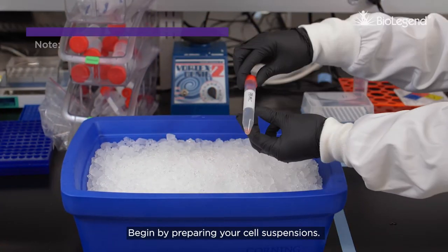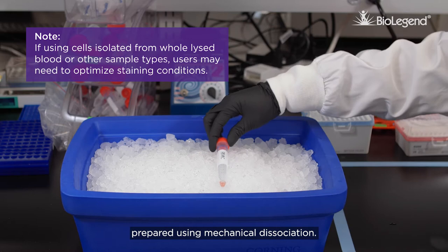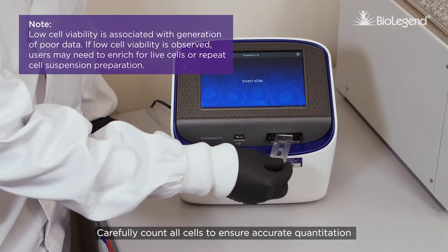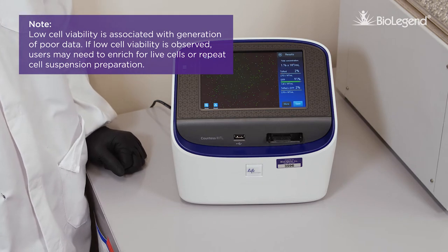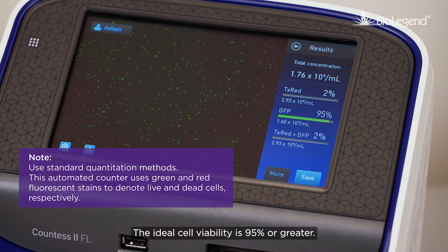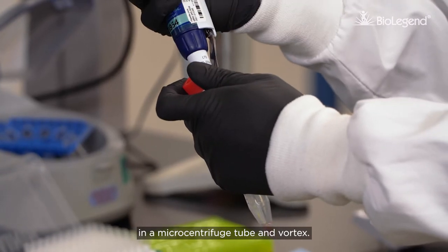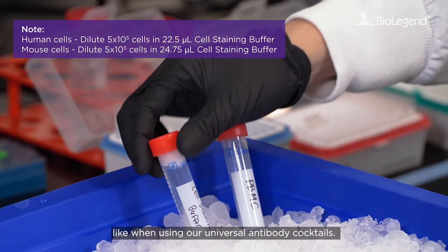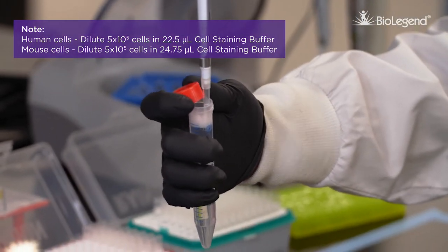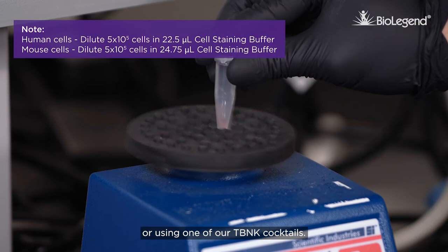Begin by preparing your cell suspensions. This protocol has been optimized using fresh human PBMCs isolated using Ficoll gradients and mouse splenocytes prepared using mechanical dissociation. Carefully count all cells to ensure accurate quantitation and assess cell viability. The ideal cell viability is 95% or greater. Dilute cells with cell staining buffer in a microcentrifuge tube and vortex. Volumes and cell numbers used in this video are appropriate when staining in a 50 microliter reaction, like when using our universal antibody cocktails. They may be scaled if you need to stain in a larger volume because you are assembling your own antibody cocktail or using one of our TBNK cocktails.